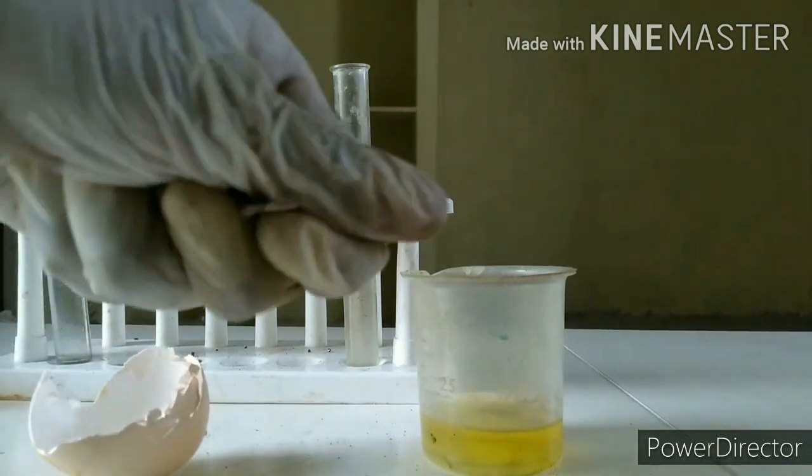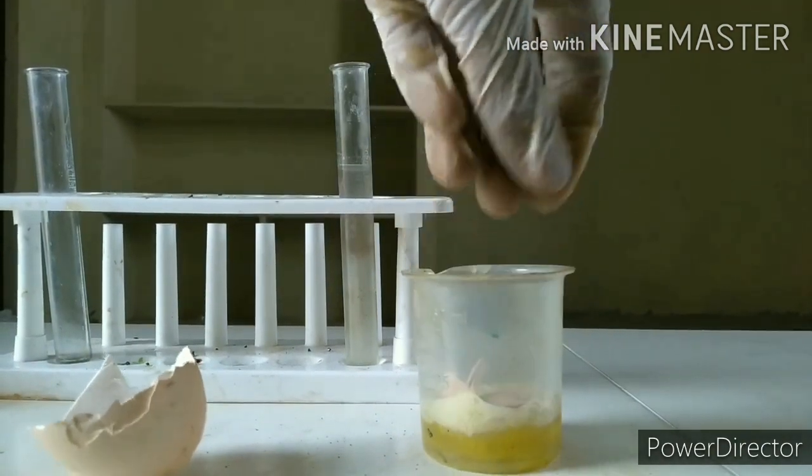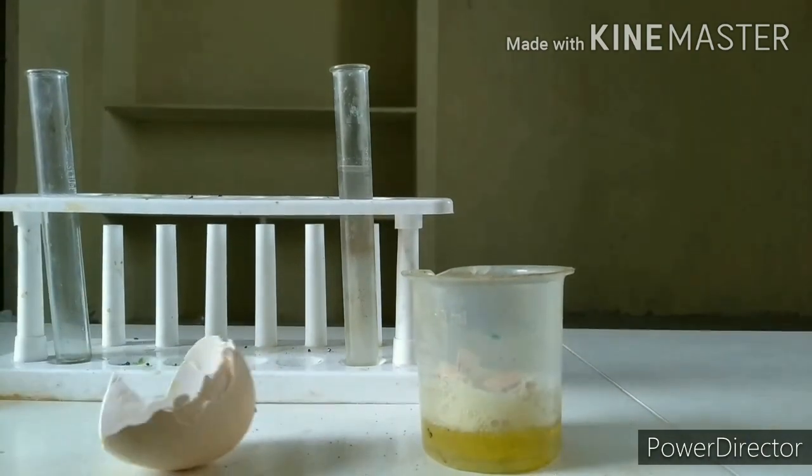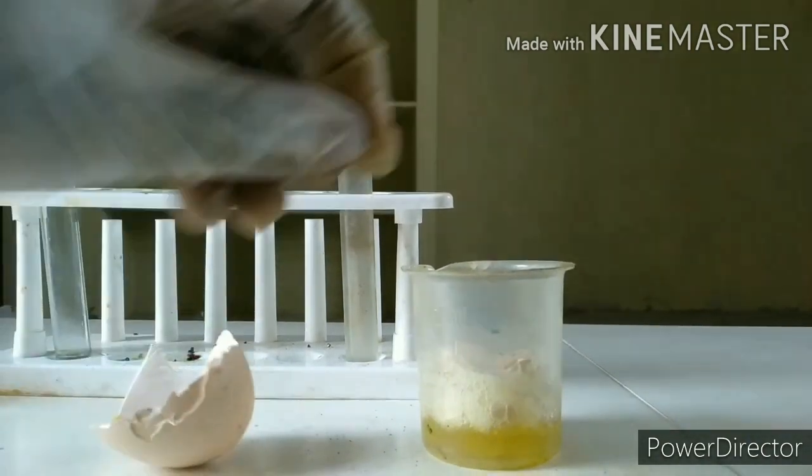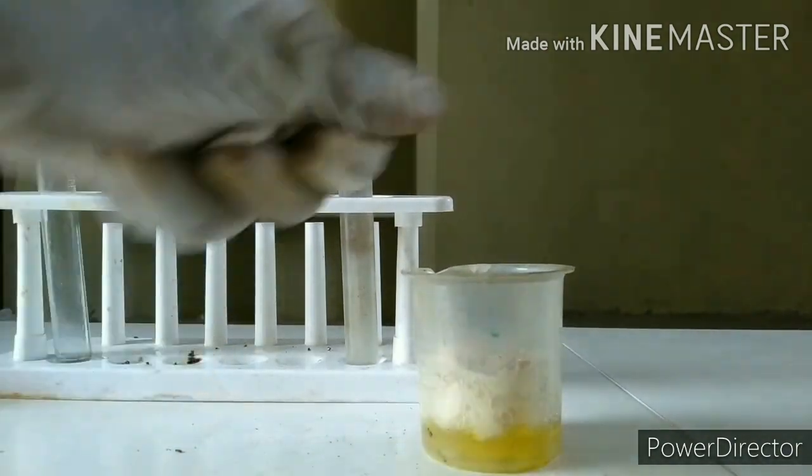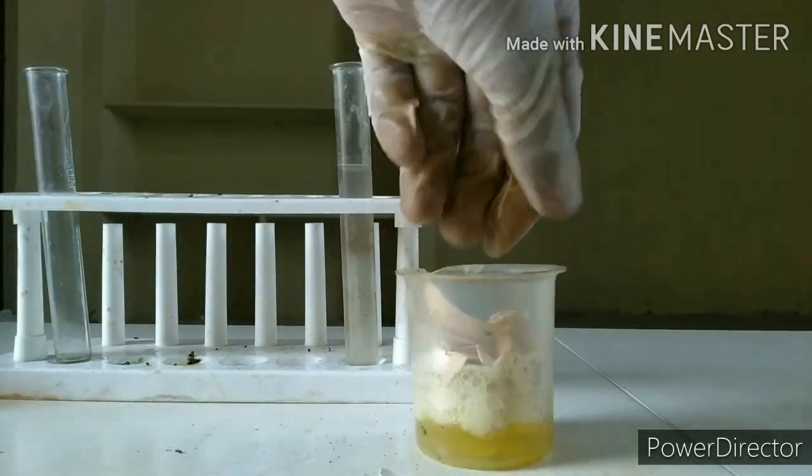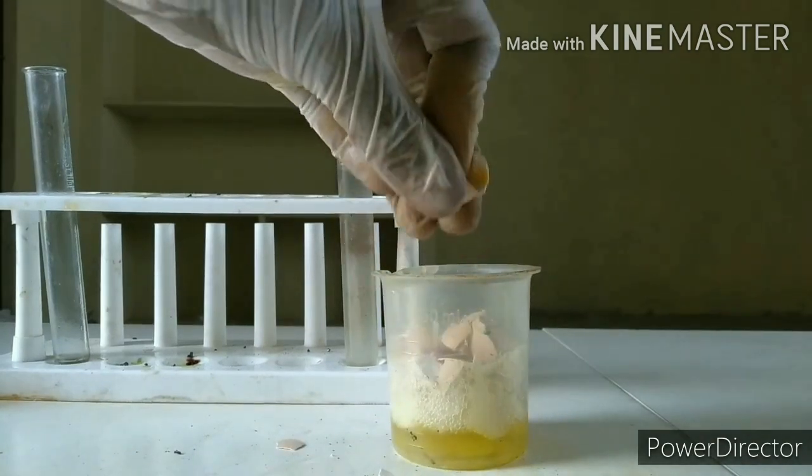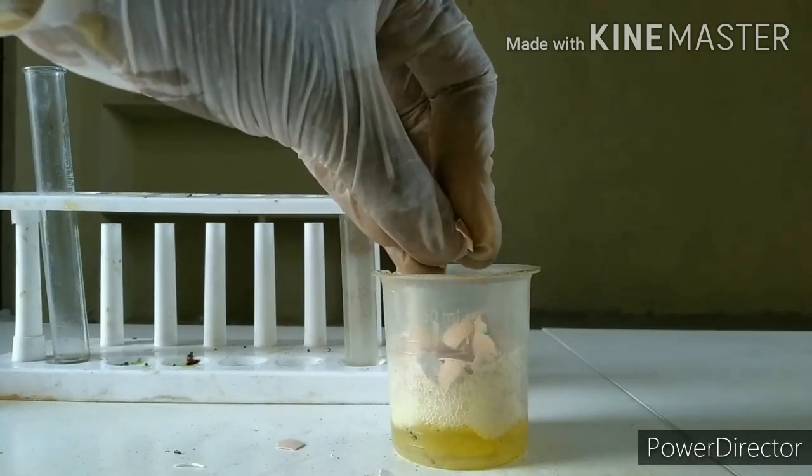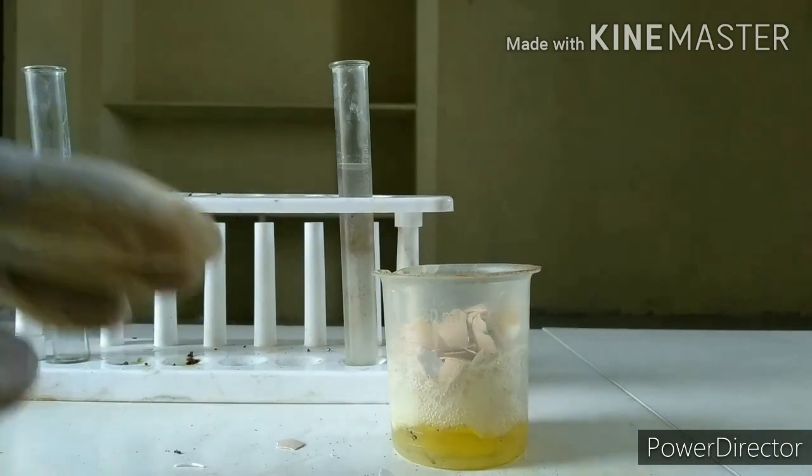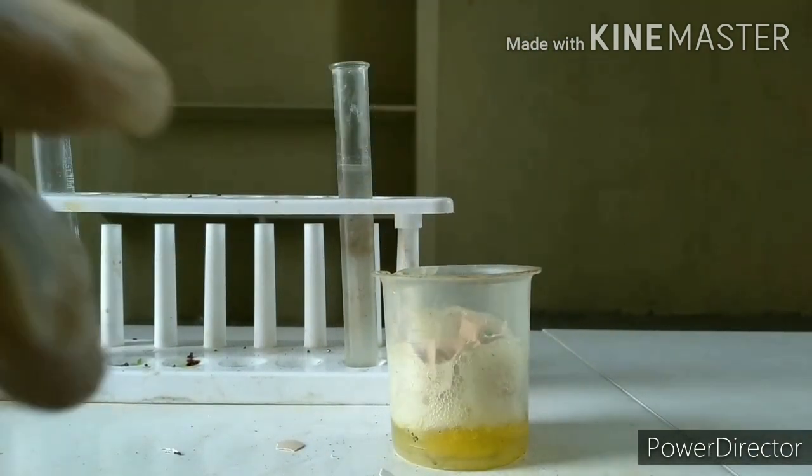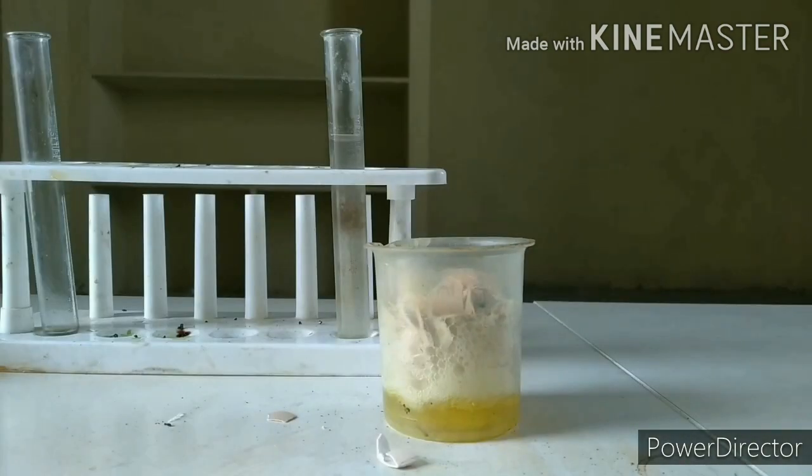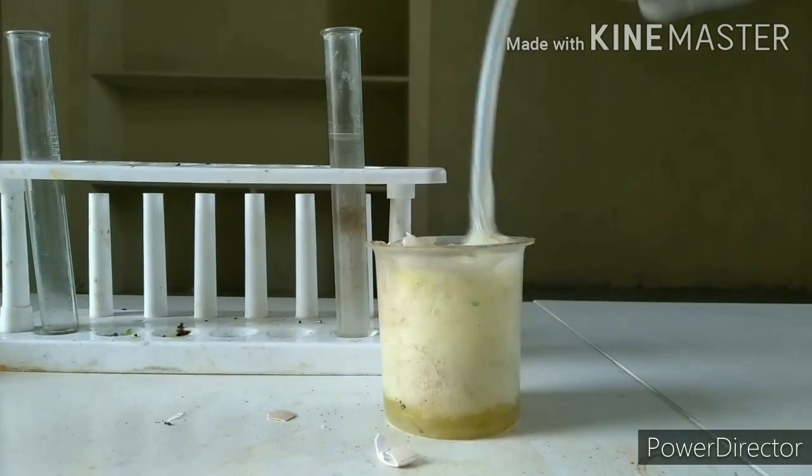I simply put these eggshells into the hydrochloric acid. It's giving a lot of effervescence, CO2 carbon dioxide. And I got all my eggshells in this. It's going to be taking a while because it will be filled with a lot of carbon dioxide and becoming a bit of a weird reaction.